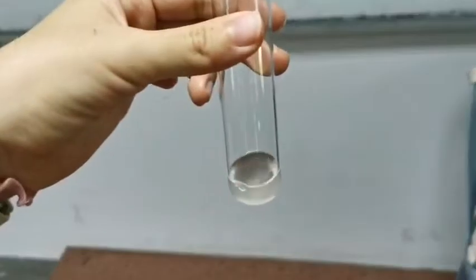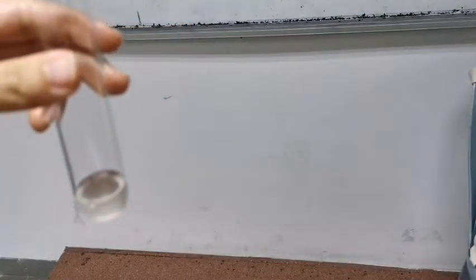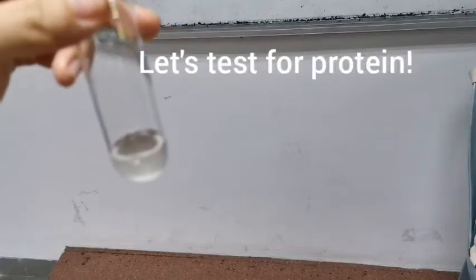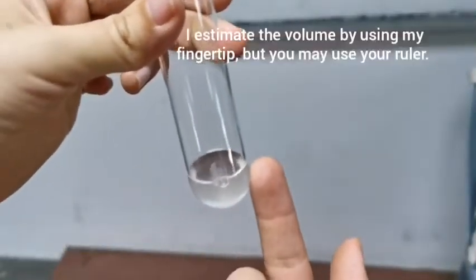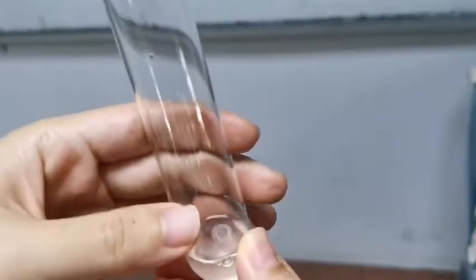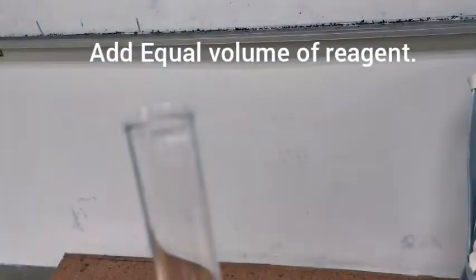Then we have this liquid solution, and if we are testing it for protein, I'm going to add an equal volume of biuret solution. You don't have to measure it accurately, you can just estimate. So look here, this is maybe around half of my fingertip, almost one of my fingertips. So I'm going to add the solution until it is about double of this portion.